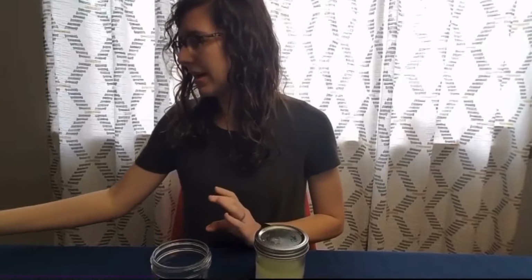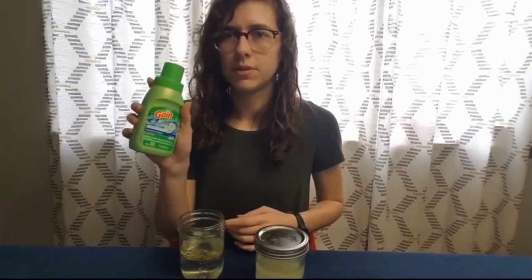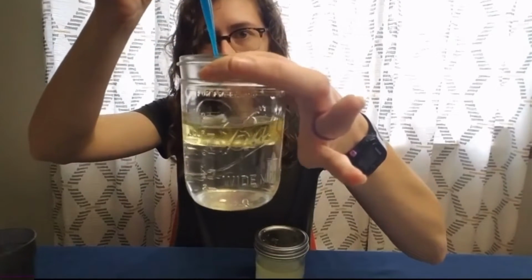So now we're going to test and see what happens whenever we use detergent. So I'm going to do the same thing. Detergent that you would use on your clothes. Let me see if I can give you a good visual here.